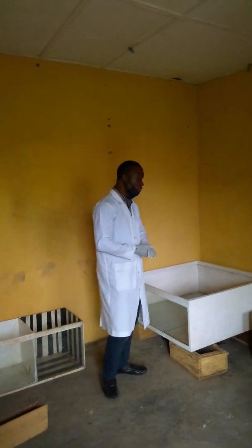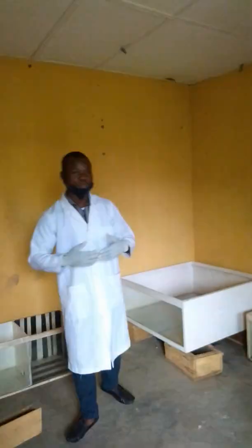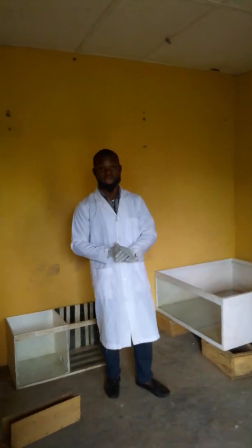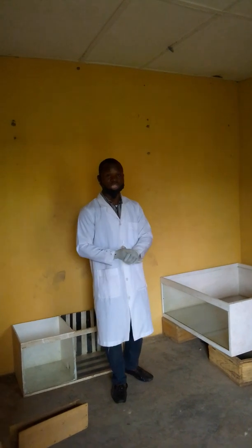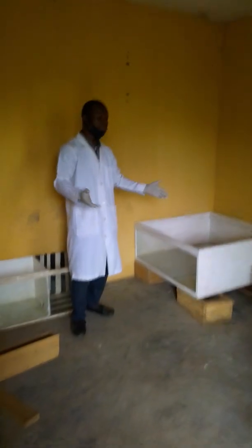So this is a short video on what we basically do in this lab, and I'm the assistant here, and most times I spend most of my days here. I've been in this lab close to 2 years now, doing fine, and we always receive work from final year students, paramedical students, anatomy students, physiology, biochemistry, and chemistry students coming to run their work here.